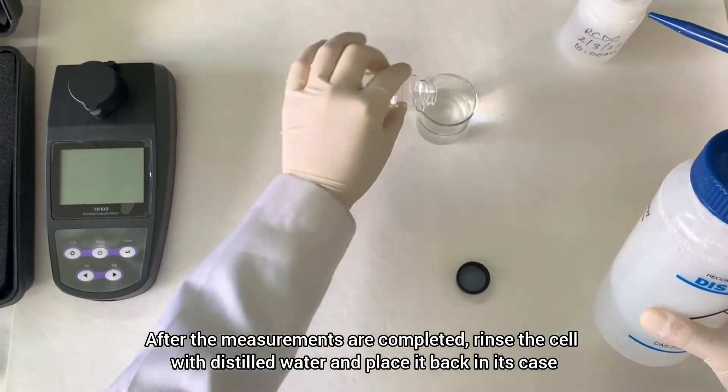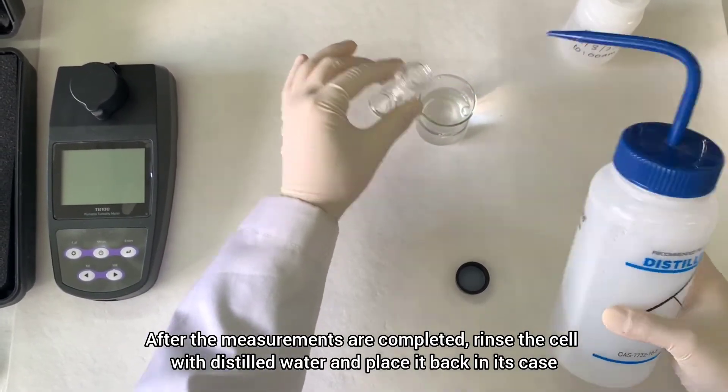After the measurements are completed, rinse the cell with distilled water and place it back in its case.